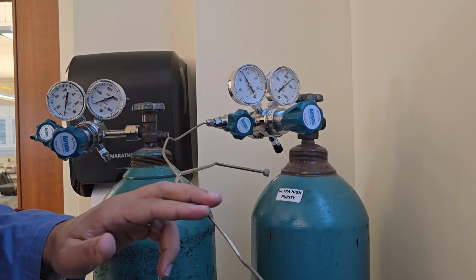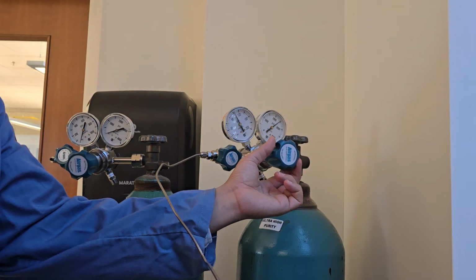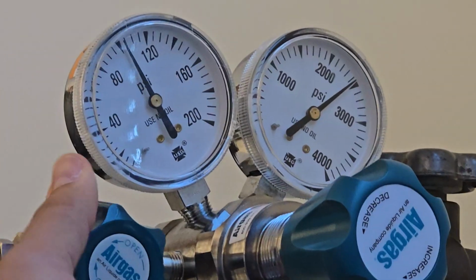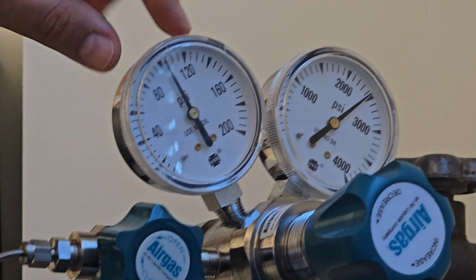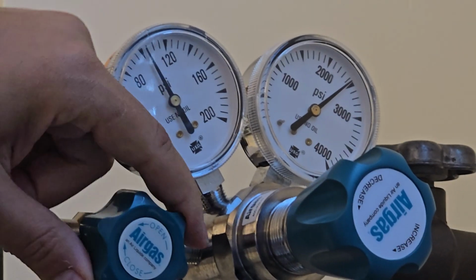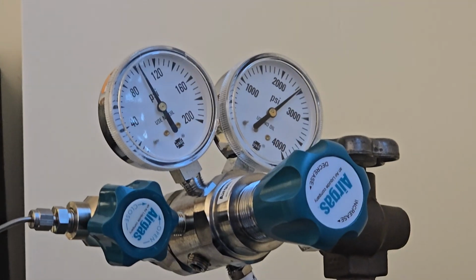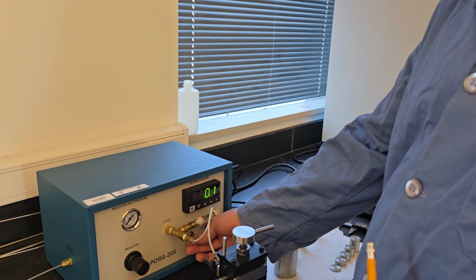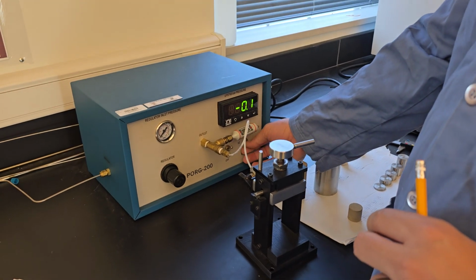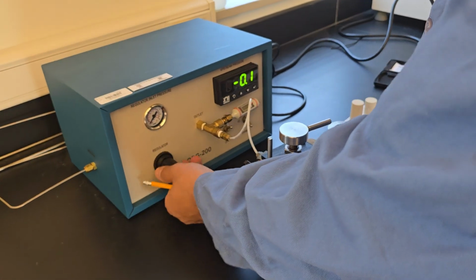We want to have about 90 psig in this experiment, so we'll rotate this right until we get to 90. We had pressure in the gauge from before, so to release it and know exactly how much gas we have, I'm going to go back to the equipment right here. I will release the pressure by putting that valve into on and that vent into expand. Then I move the regulator to allow the gas to pass through.